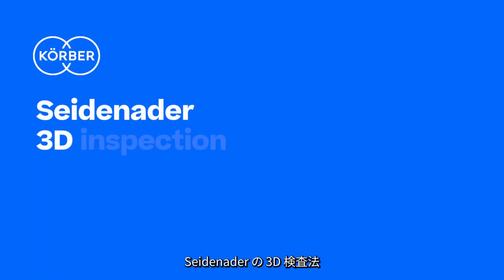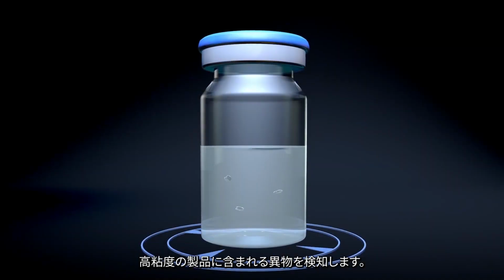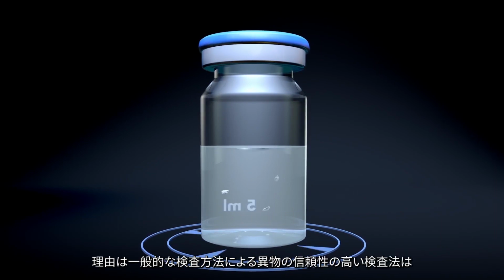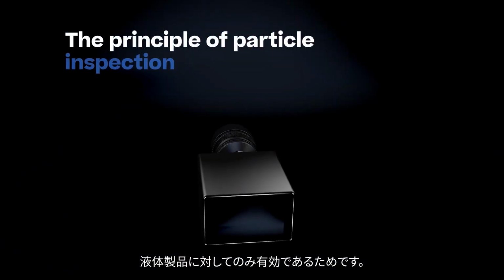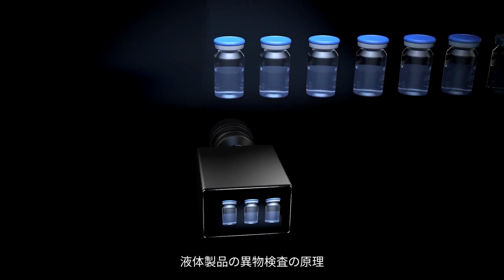Seidenader 3D inspection. Conventional inspection extended by a third dimension to detect particles in highly viscous products. Inspecting highly viscous products can be quite challenging, since a reliable detection of particles with common inspection methods works only for liquid products.